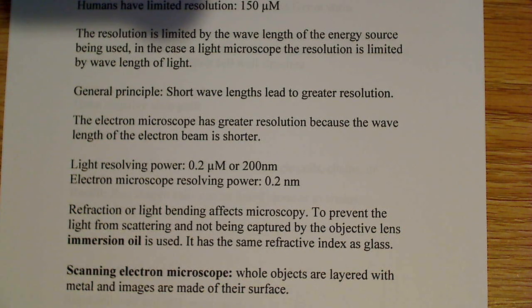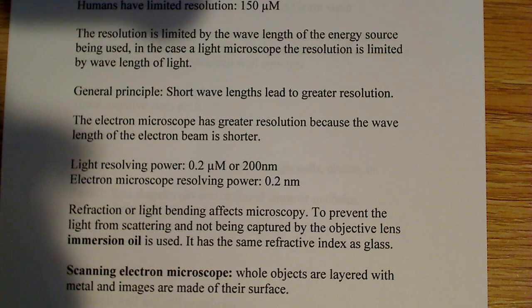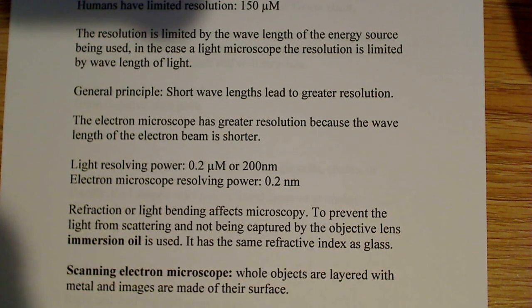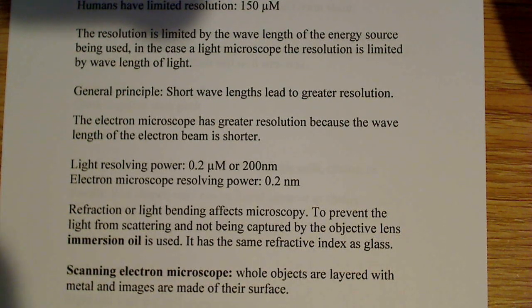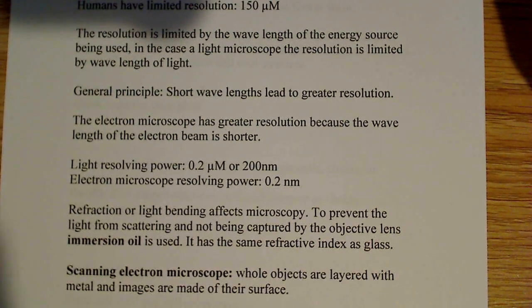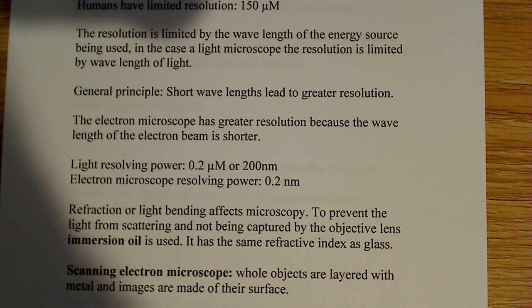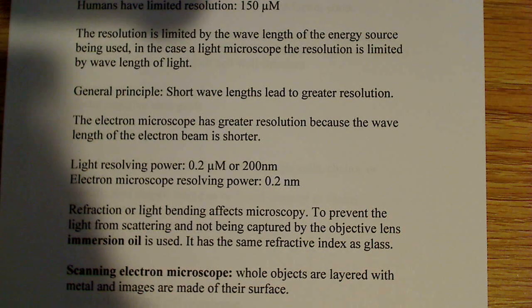The electron microscope has greater resolution because the electron beam being used has a much shorter wavelength. That's why you'll see a lot of electron micrographs in your textbook — they are high-resolution images. Scanning electron microscopes show the surface of whatever you're viewing, like a bacteria cell, while transmission electron microscopes show the internals — DNA, mitochondria in yeast, for example.